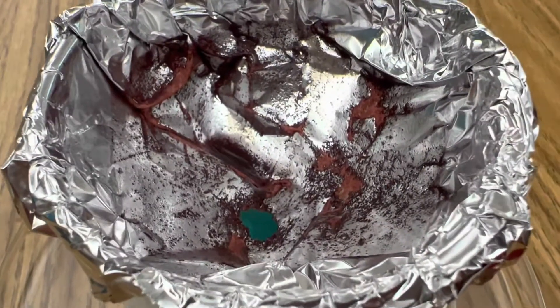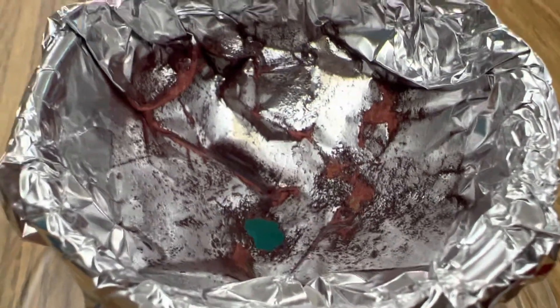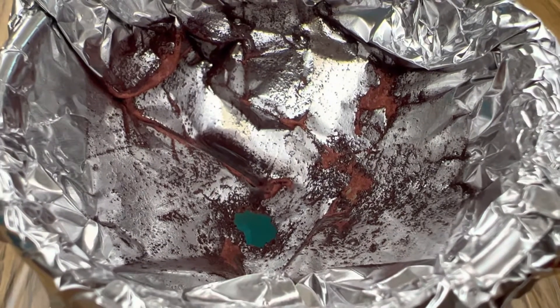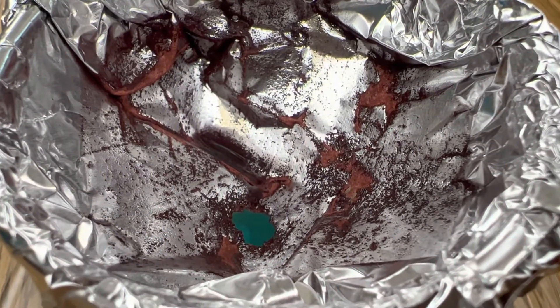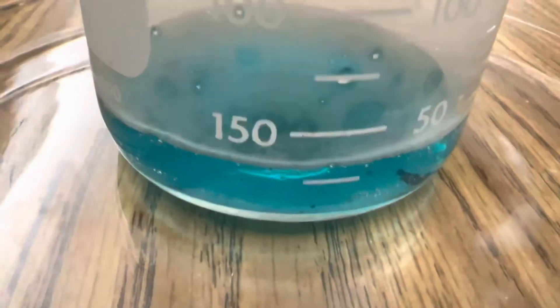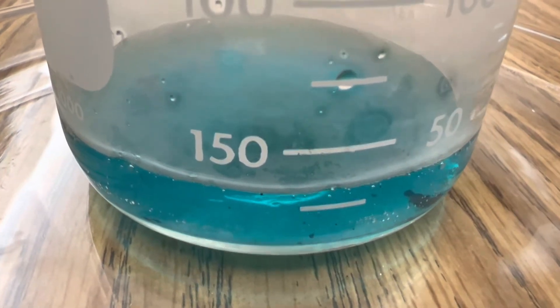Here you can clearly see copper on the aluminum foil, and that's because aluminum is so much higher on the activity series. In this single displacement reaction, copper chloride trades places with the aluminum — you get aluminum chloride at the bottom and it changes color a little bit, and up here you can actually see the copper, which is the brown residue on the aluminum.